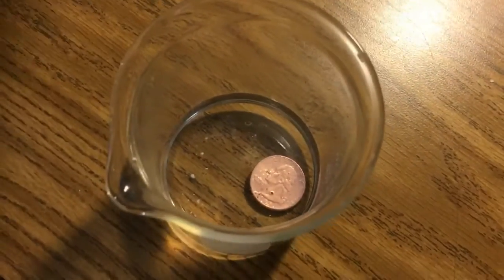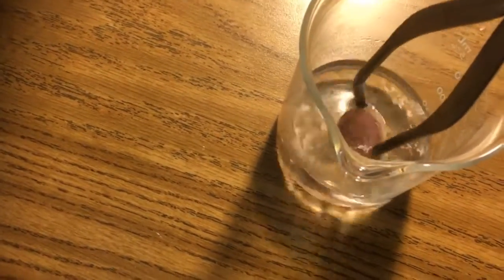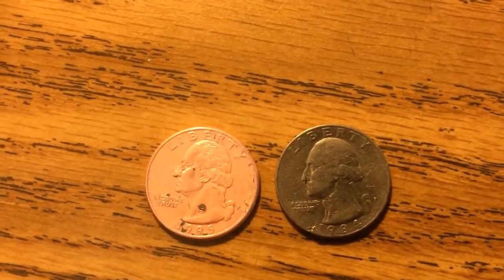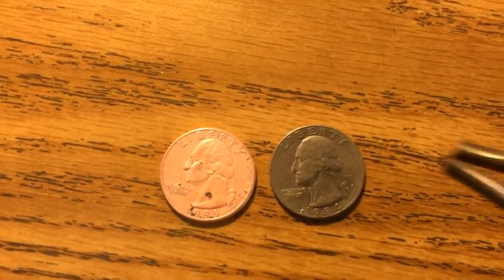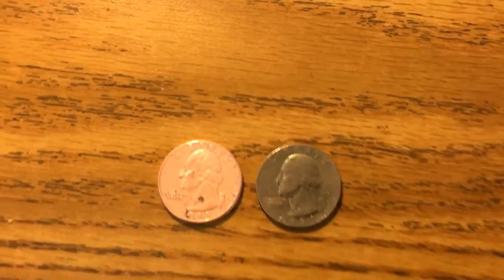Okay, now we're going to do a comparison. We want to dry this off and compare it to a quarter that has not been treated. Let's put it next to this quarter right here. Look at that — can you see the difference? You can actually see a little fleck of silver right there that's still electroplated to the copper, but you can see a pretty dramatic decomposition. So Pooja, you've got a pretty weird quarter to take home with you today. Good job.